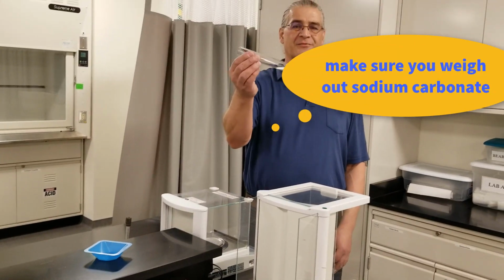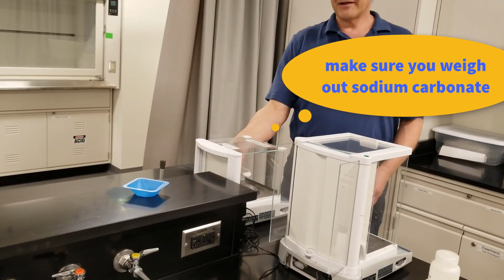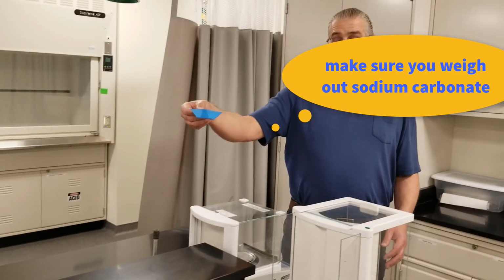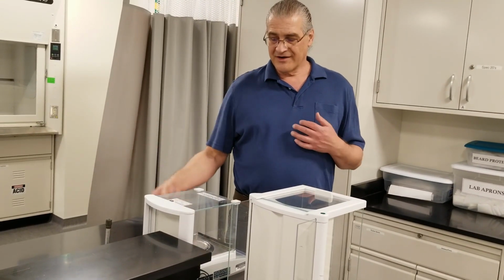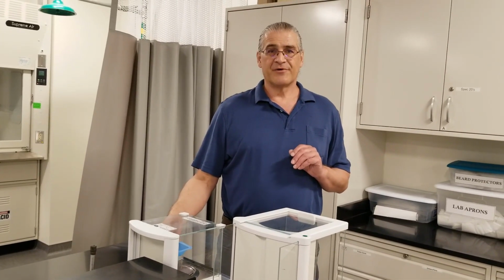Okay, here's my sodium carbonate from part A. We've weighed it on the balance. Now we're going to transfer it to a weigh boat here. And there's the sodium carbonate I'll be working with. Your instructor may want you to weigh it in the weigh boat, use it, and weigh it again. It depends on if you're going to complete that part of the report sheet.